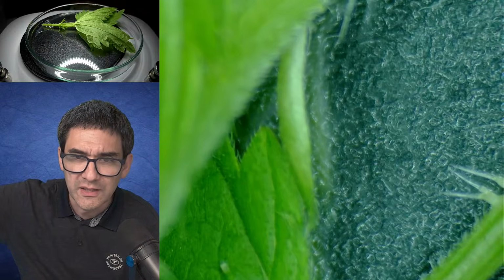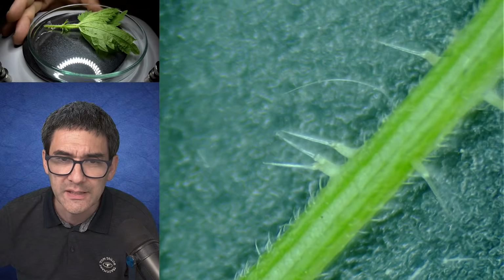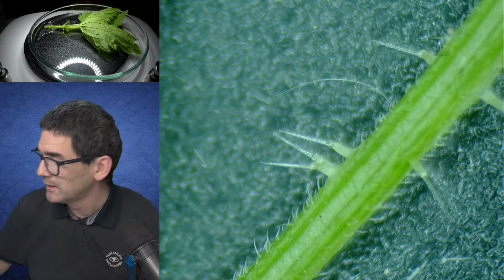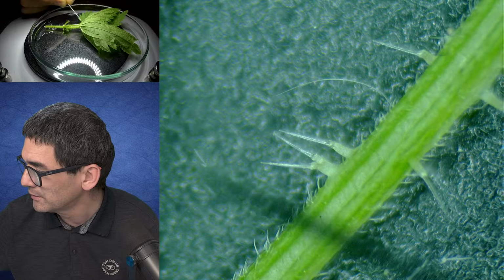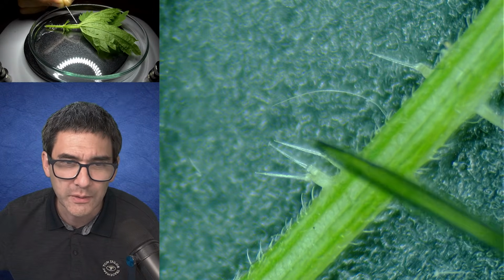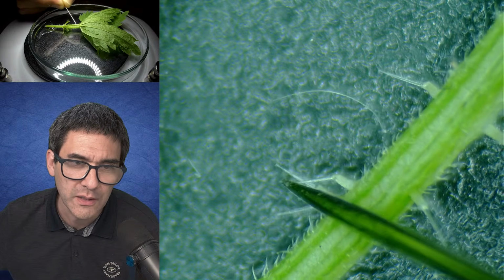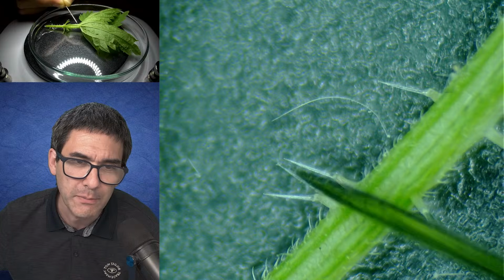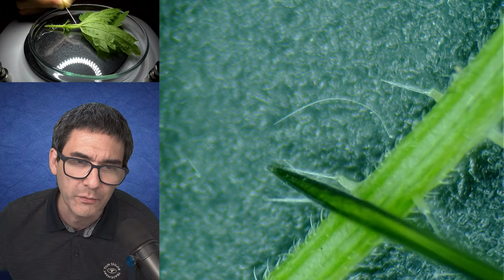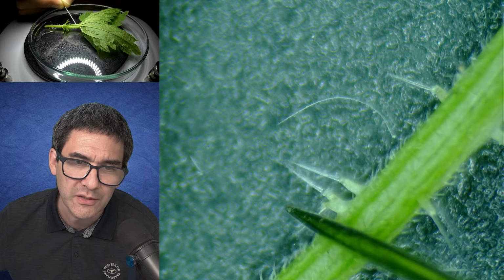Unfortunately, I was not able to see it this time. It depends a little bit maybe how fresh the plant is, but I've got a pin here, a regular pin as used in sewing. Look at this, just for size comparison. Look what happens when you touch it. They're pretty flexible. Actually, they look kind of soft. I've done this already before, and then I was able to see that a droplet of liquid came out. Unfortunately, I'm not able to see that here.